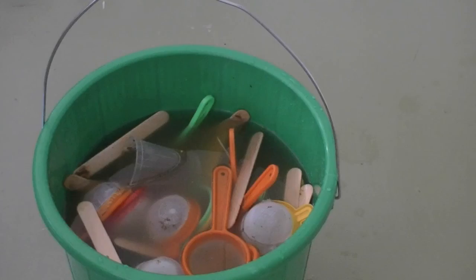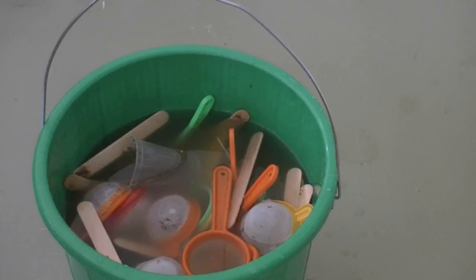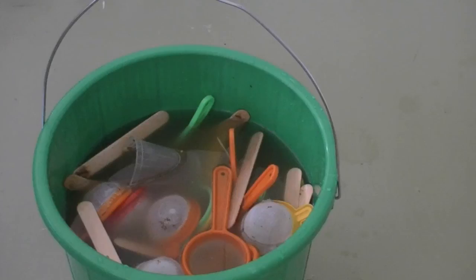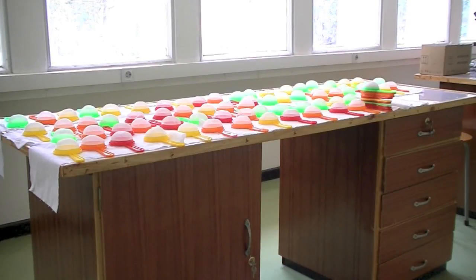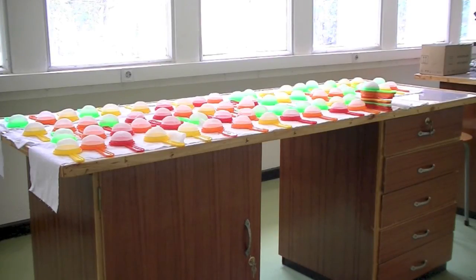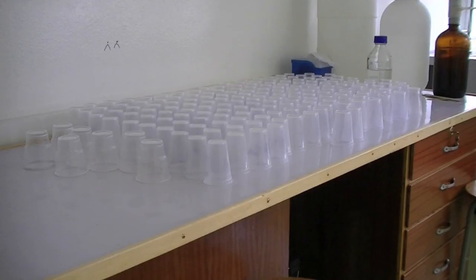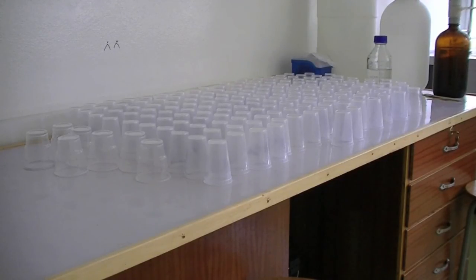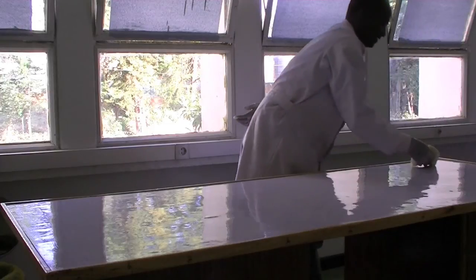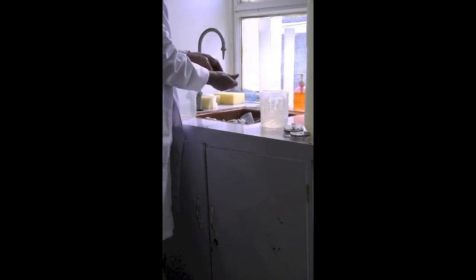Fourth, when you re-use equipment, it is important to thoroughly soak all the sieves, containers and spatulas first, then carefully wash and dry all the materials. Fifth, make sure that all labelling on the beakers is removed. Sixth, disinfect all tables and wash your hands.